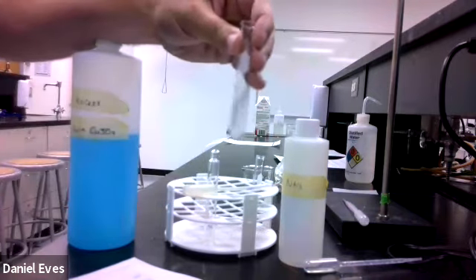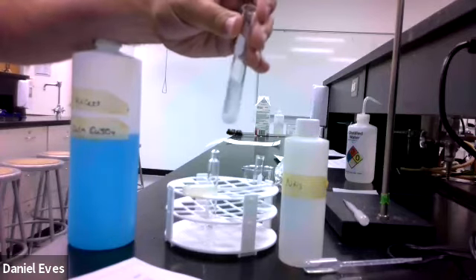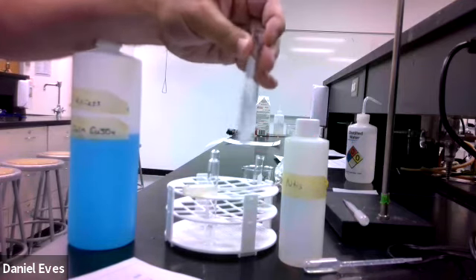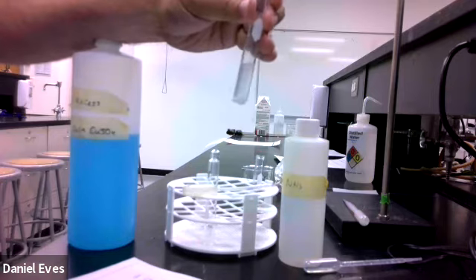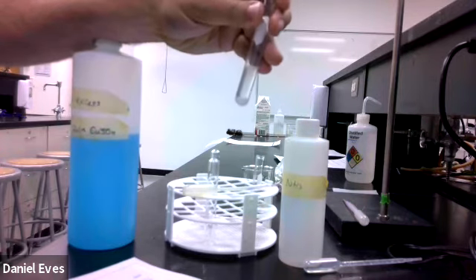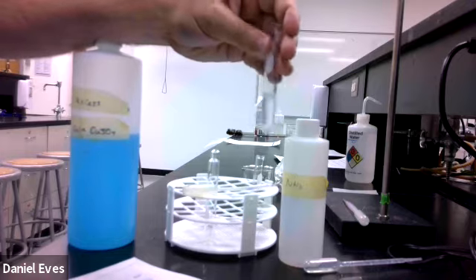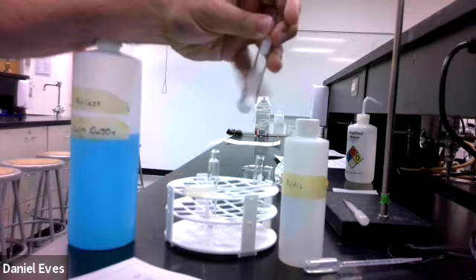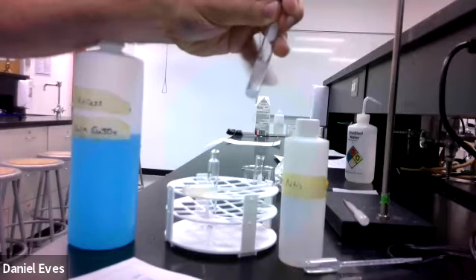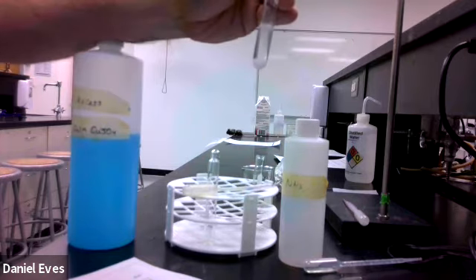Okay, so we want to mix this together as best that we can. Now, in this specific situation, because we're making a solution, this is not a chemical reaction as we know it. It's just a solution process. And so the solid is going into solution. We're taking solid ammonium chloride and turning it into aqueous ammonium chloride. That's the process taking place. So when we write out the equation, we want to make sure that's what is represented on the page. I'm just trying to make sure that I get as much of the solid there as I can.